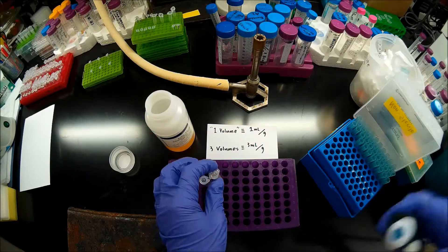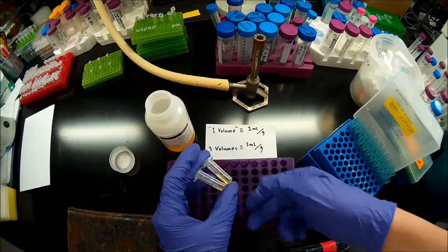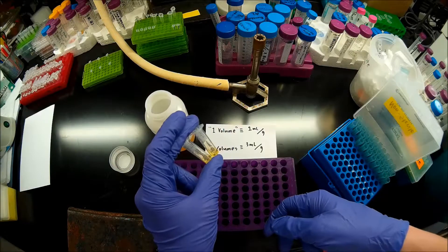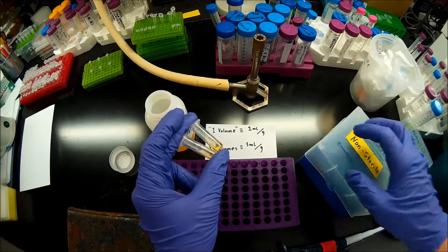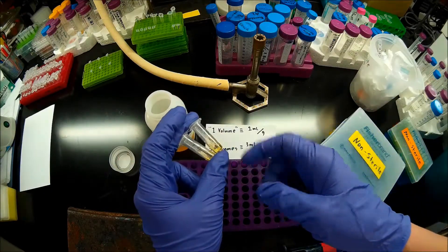At this point, I'm going to take both of these samples, and I'm going to put them in a 50 degree water bath. I'll vortex them intermittently until the agarose slab is completely dissolved.